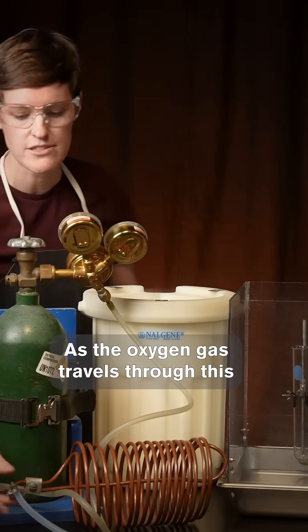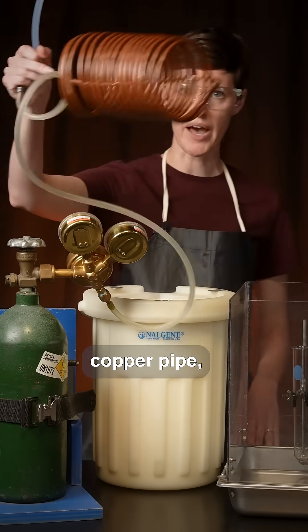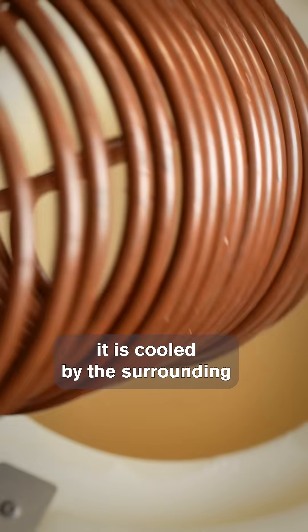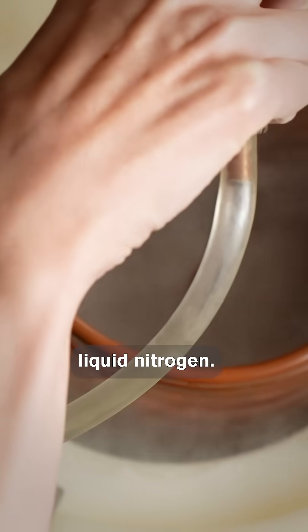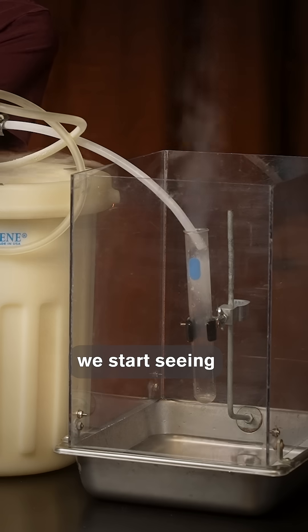As the oxygen gas travels through this copper pipe, it is cooled by the surrounding liquid nitrogen, and eventually we start seeing liquid oxygen coming out the other end.